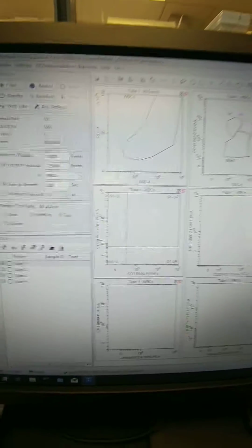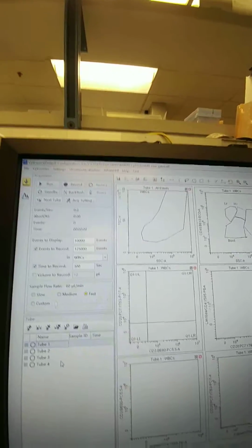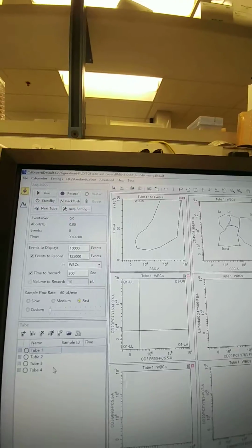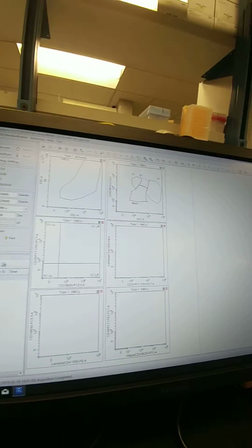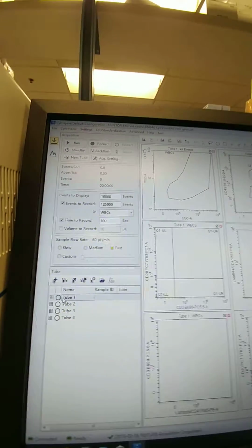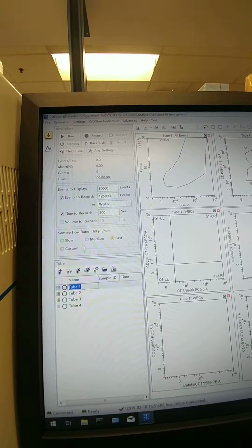Now anytime you do a new experiment from template, it's going to load with those acquisition settings and the compensation values currently applied. So that's what I mean by you don't need to set those every single time. If you've saved it in your template, you can just load your template and be good to go. Although it is always good to double check. So I know that's right, and close. Okay, now we can go ahead and run all 4 tubes, run a few just to make sure we can analyze and that the new settings look good.